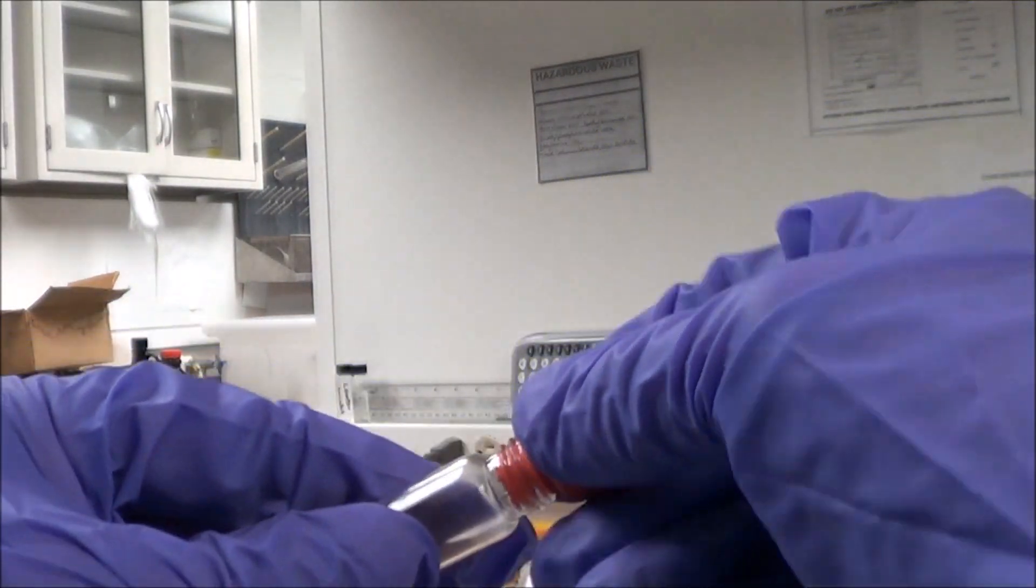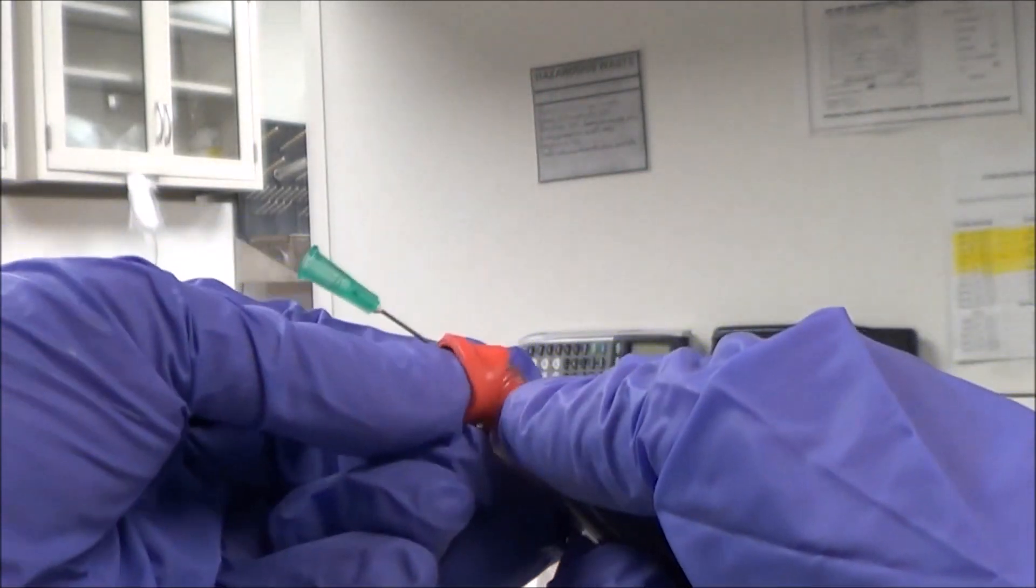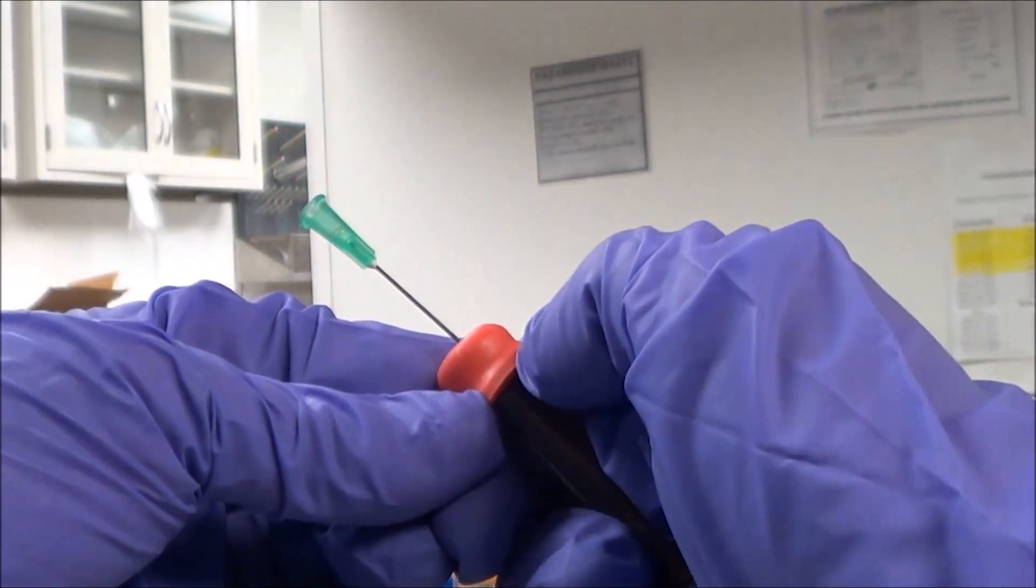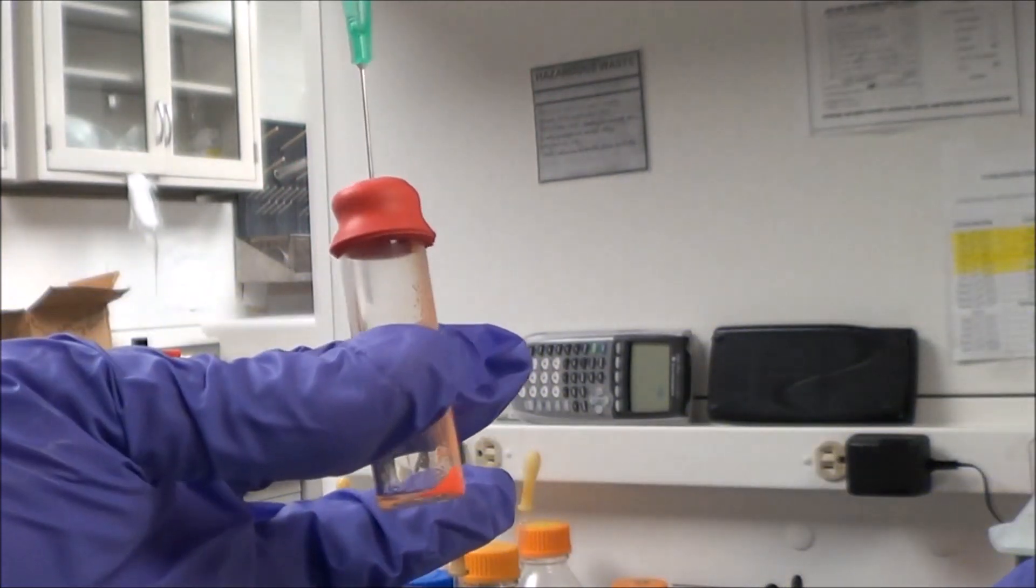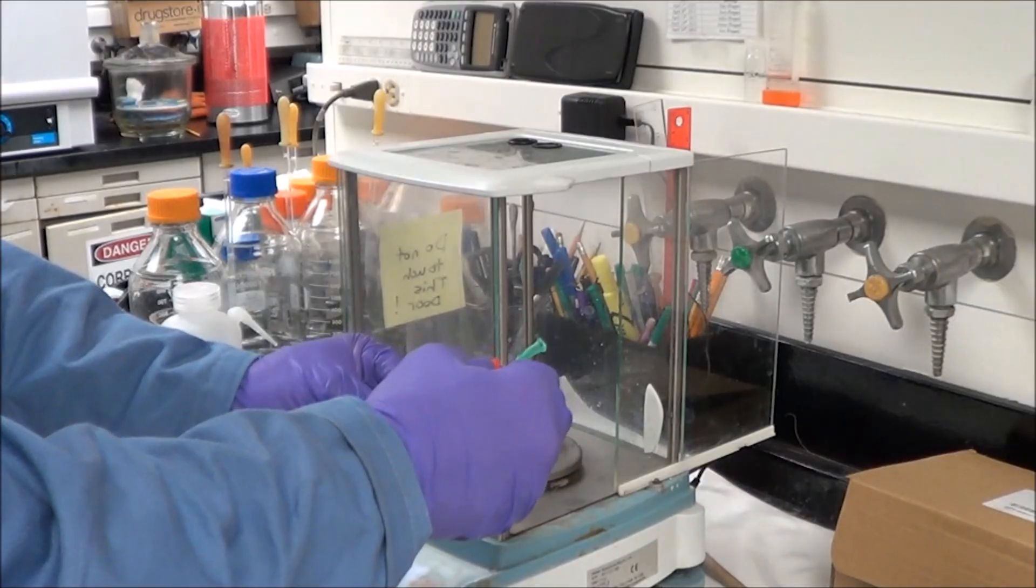Of course, we're also doing this with cadmium selenide the same way. Septa with the green 21-gauge needle. I usually reuse the septa and the needle for this initial drying, and then later when I'll dry the sample in the chloroform polymer solution.